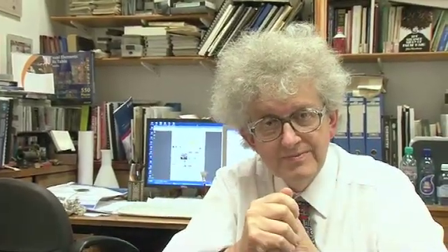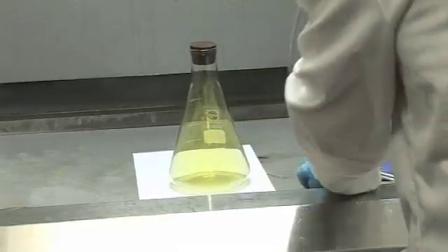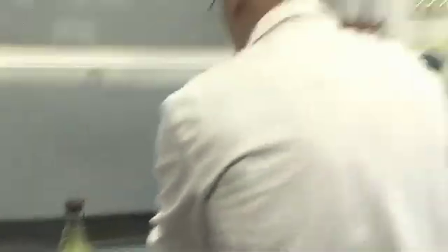It wasn't a terribly good weapon because it could quite easily, if the wind changed direction, it could blow the gas back to the people who were letting it out. So we'll just put a stopper in to contain the gas while we prepare the rest of the experiment.